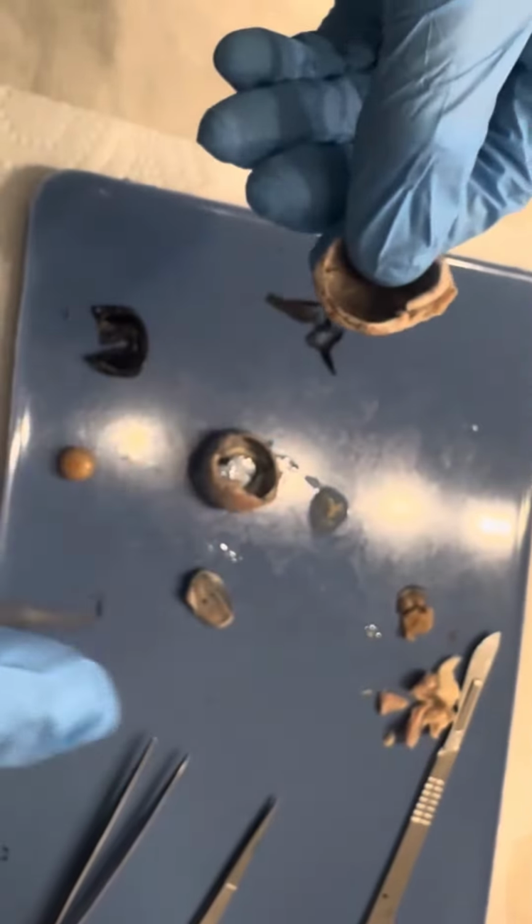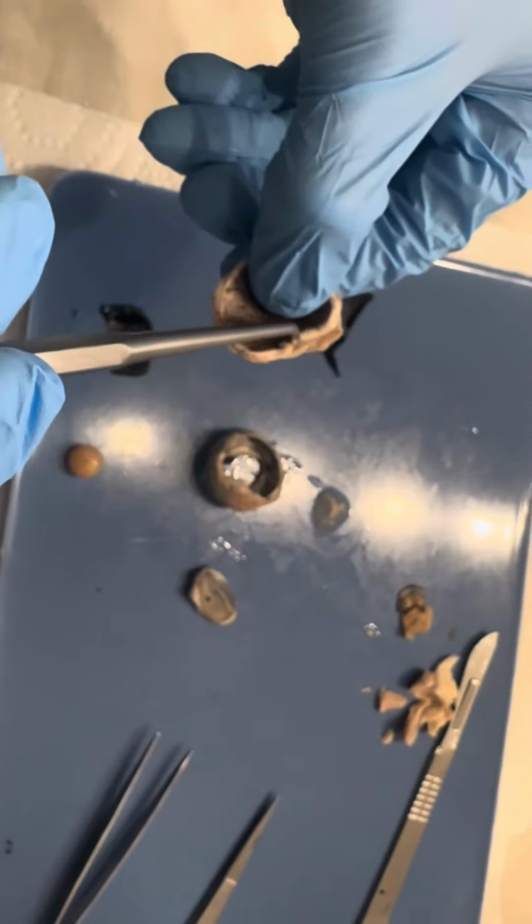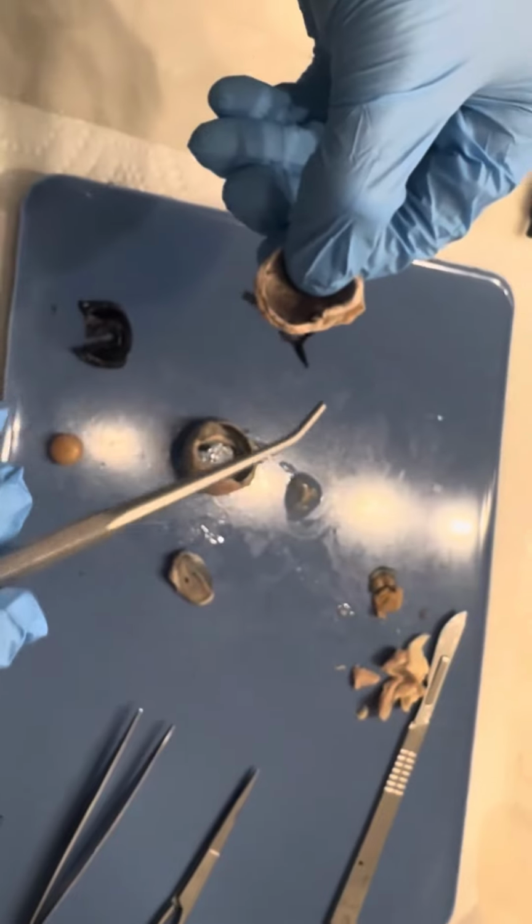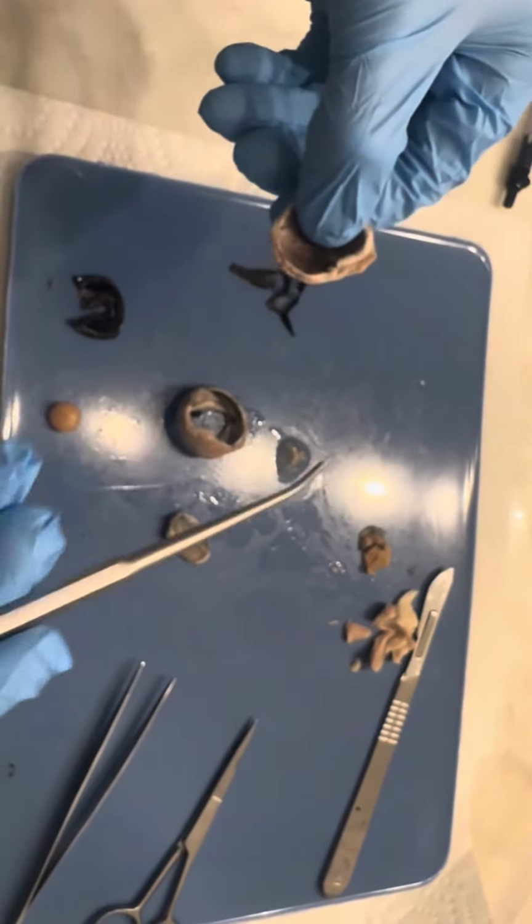On the inside, right behind where that optic nerve starts, we call this the blind spot. So this is where the receptors converge to form the optic nerve. We'll talk about receptors in a minute.